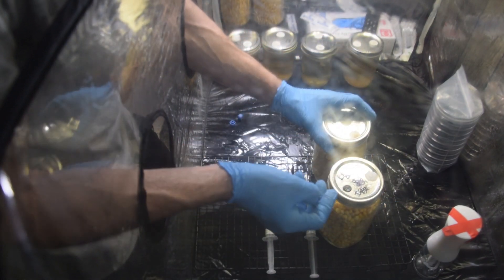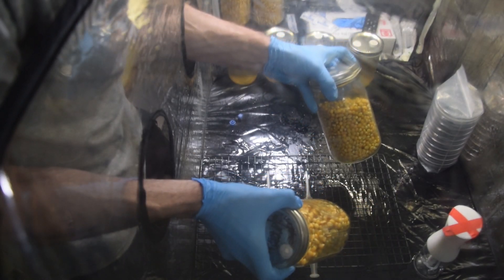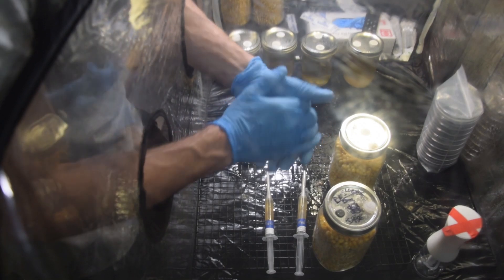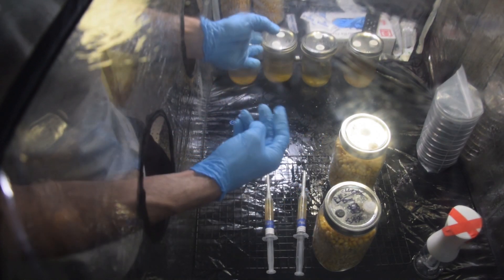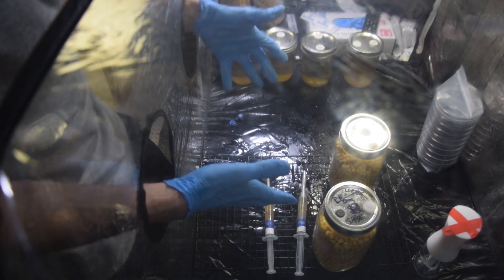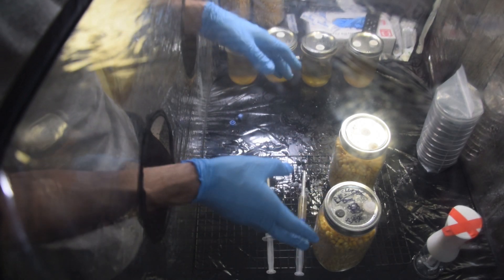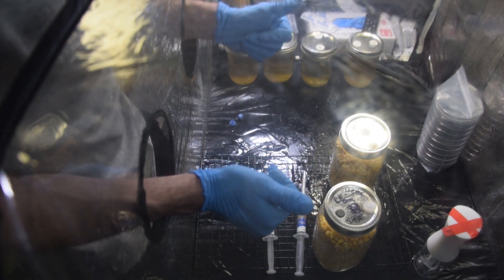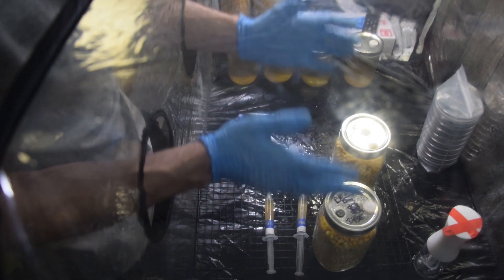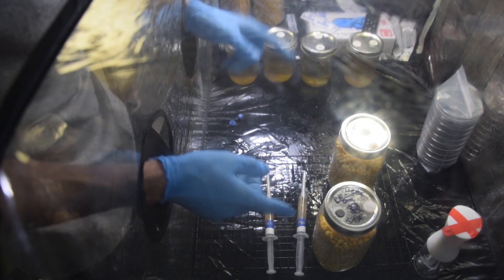I like to shake mine generally, so I'll shake those coral tooth ones. That is how you inoculate your grain spawn with a liquid culture — same process with a spore syringe, there's nothing different there. Now these are going to go in my incubation tent. I have a little grow tent that I use — it's dark, it's warm, I put grow mats in there. It's perfect for that incubation time, so that's where these are going.